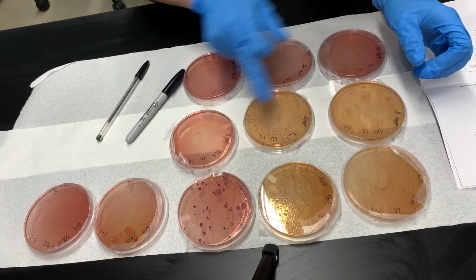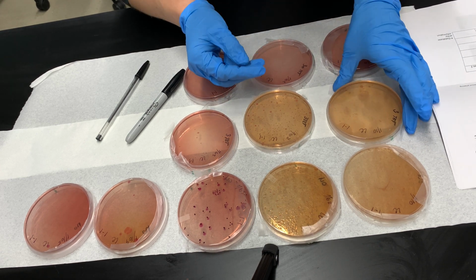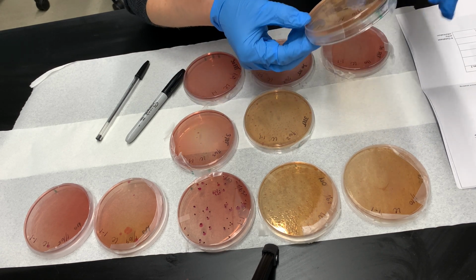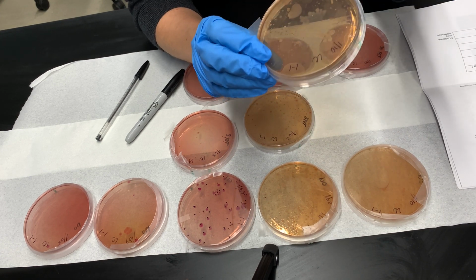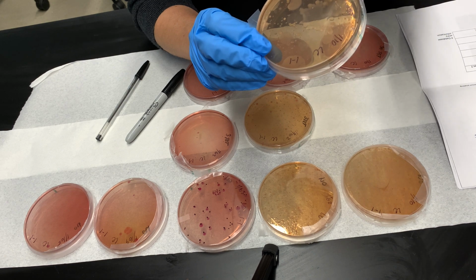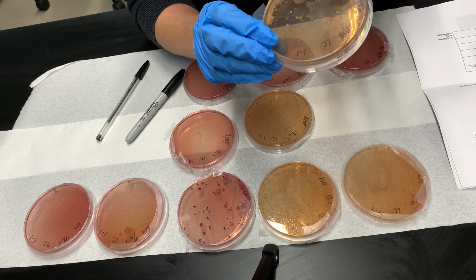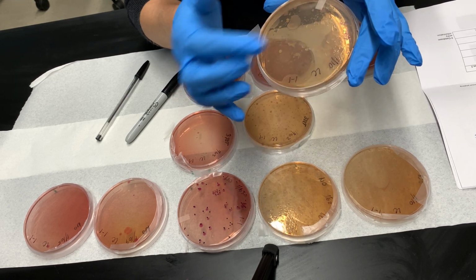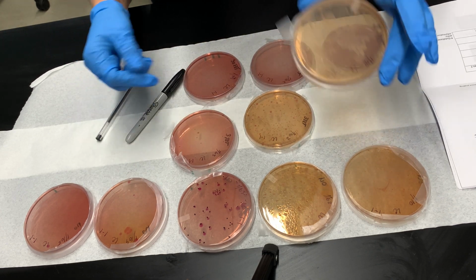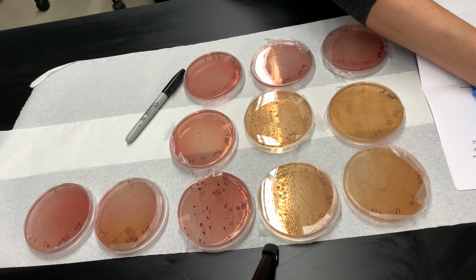Same thing I will do with my tetracycline plates. I start with the 3 tet. This plate has some individual colonies, but then big patches. This is probably thousands of bacterial colonies next to each other, merged in a big blob. So this is for me definitely too many. I would even say some patches of overgrowth. So this will not be countable. I won't be able to count this. It's either too many or overgrowth.